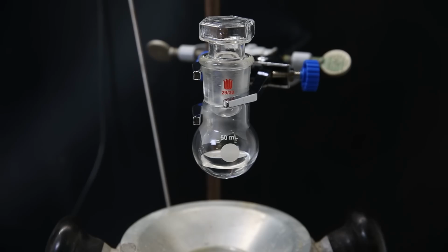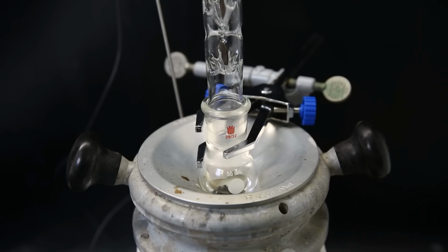So the best option might be to hydrogenate this crude product, and then try to separate it afterward. But I also tried to do a fractional distillation at regular pressure, and that didn't really work out, and the liquid turned black. So I guess that won't go through. So I quit, cause this stuff is kinda annoying.